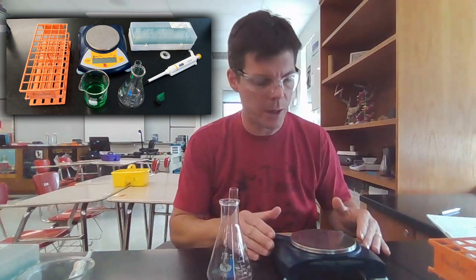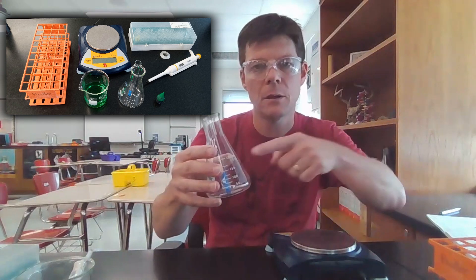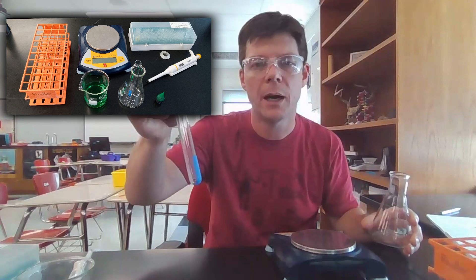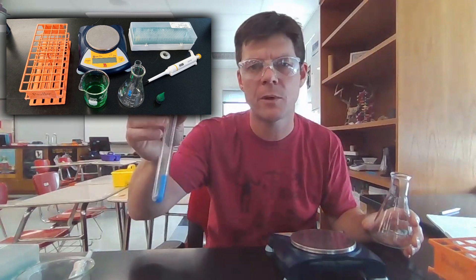Let's look at the equipment that we'll be using first. I have an electronic balance. We'll also use an Erlenmeyer flask with a small test tube. For this experiment, narrower test tubes are better than wider ones.